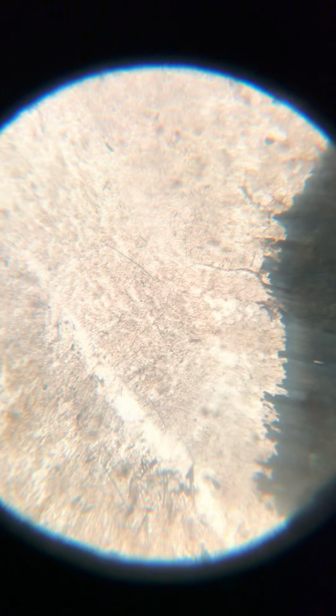Some black minerals in here with very diagnostic cleavage. These very textured but low relief feldspars. That was plain polarized light, and this is what they look like in cross polarized light. So that is the alkali feldspar.